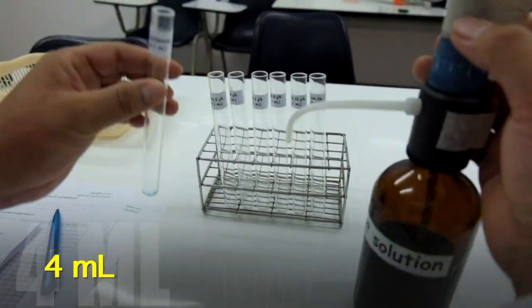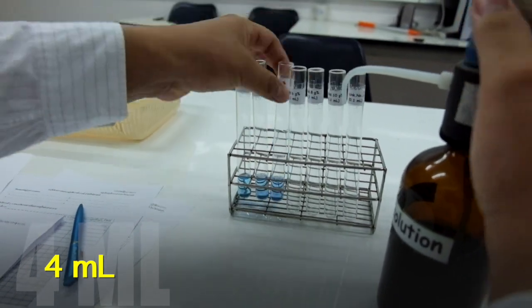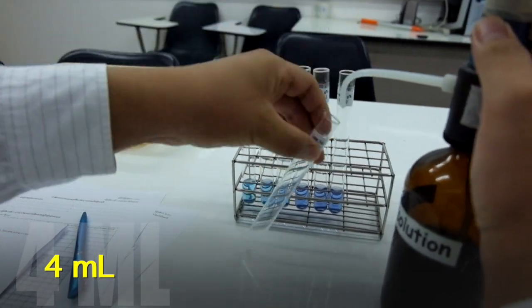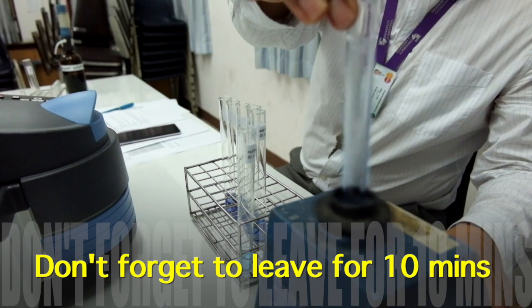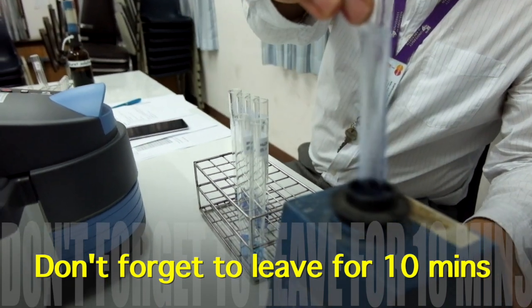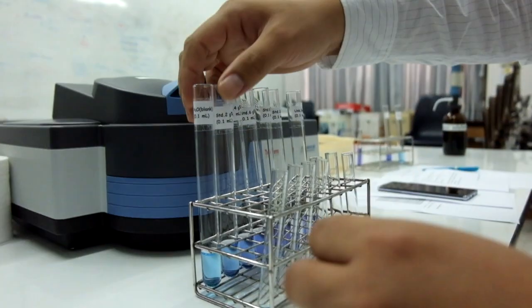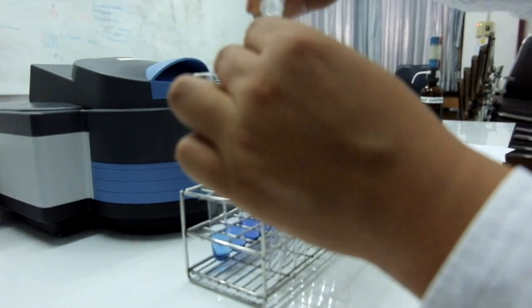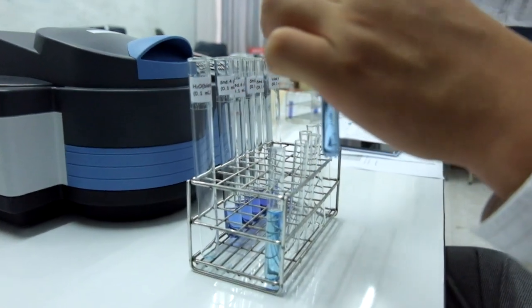Starting with, fill all tubes with 4 ml of biuret solution. Mix well with a vortex mixer and leave them for 10 minutes. After that, pour the solution into each cuvette and determine the absorbance at the lambda max.